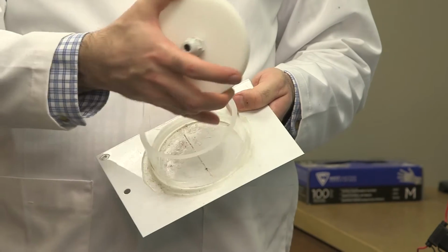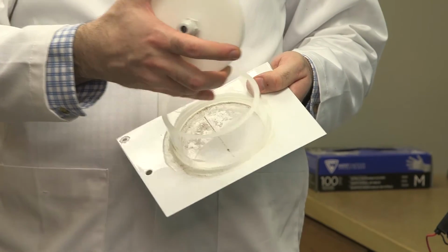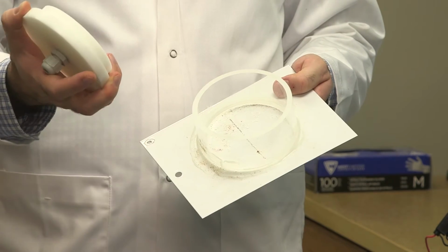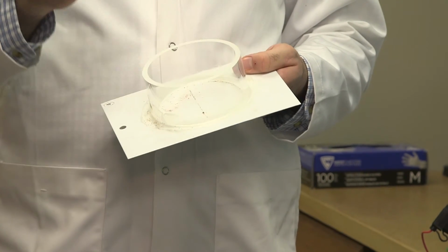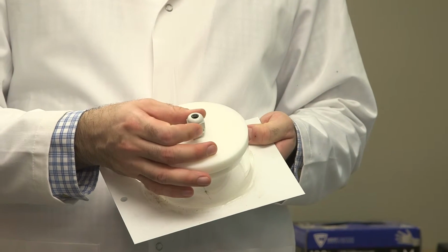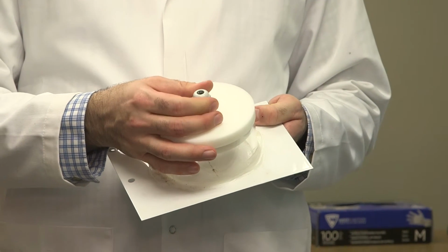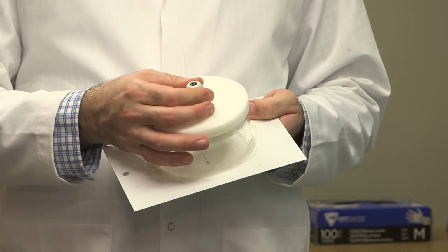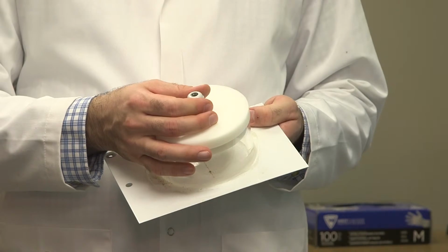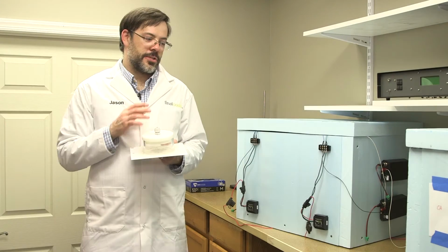And then we fill this with the electrolyte that we're going to use, and it's often the same kind of electrolyte that we use in the Q fog experiments. And then we put the lid on the cell, and in the center there's a hole for a reference electrode. That reference electrode allows us to get information used to quantify the corrosion rate difference between the test and the control. We have these samples in two different chambers.